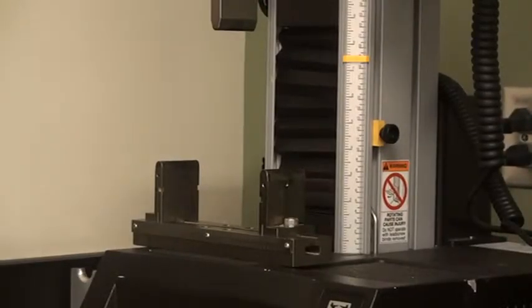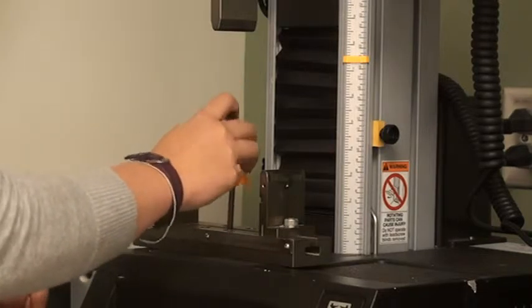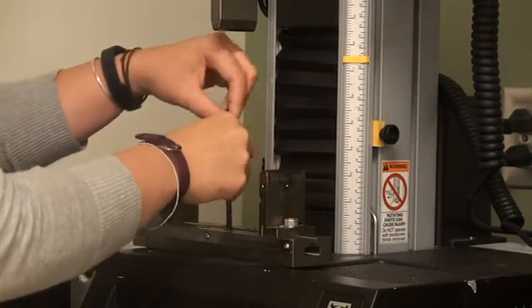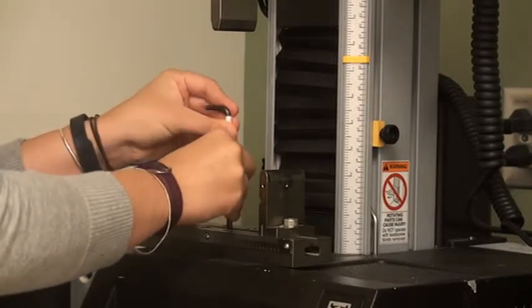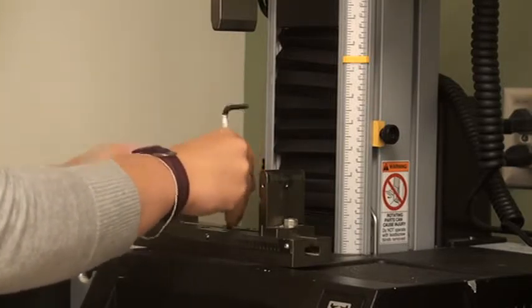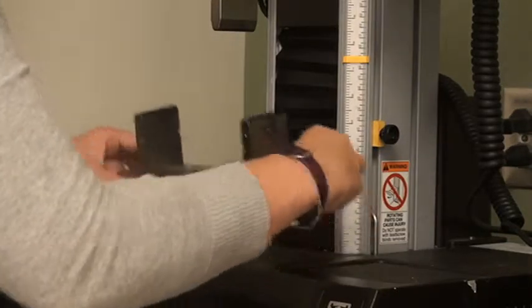To remove the larger bottom flexure fixture assembly, use the 3/16 inch hex wrench to loosen the central screw. Remove the screw and lift the assembly off the system base.